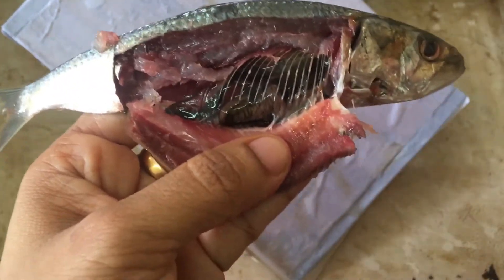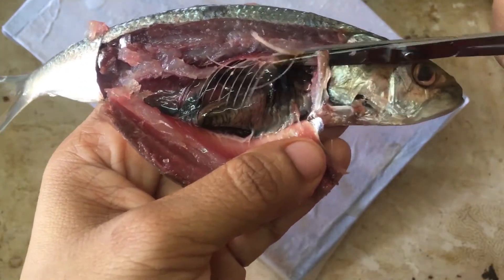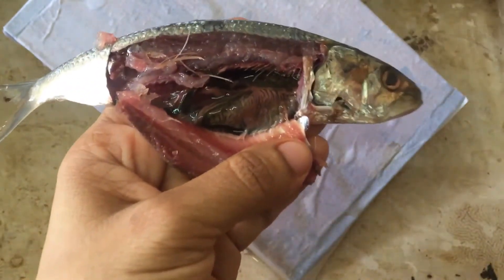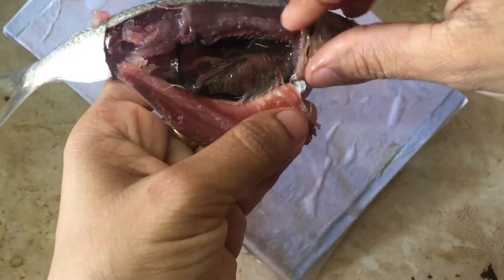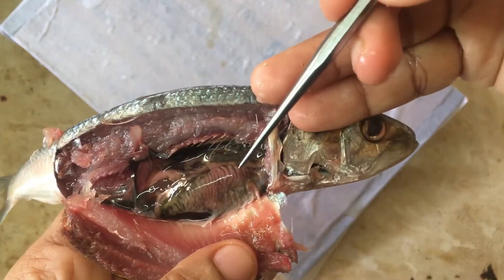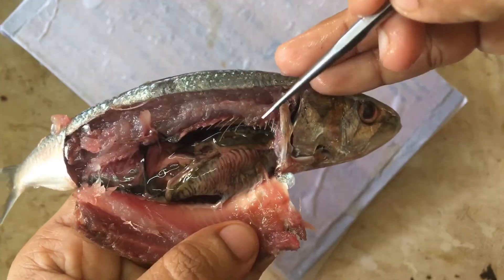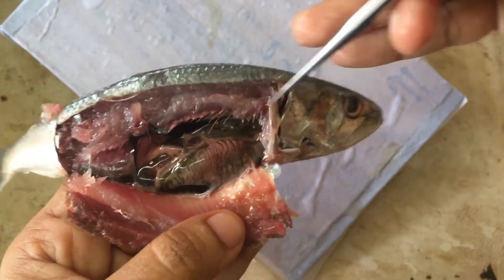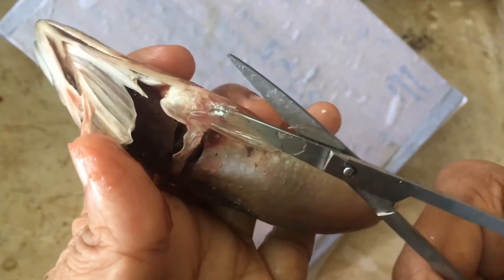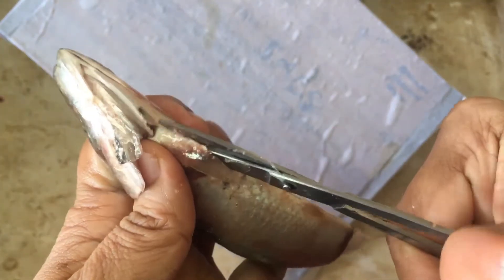We can open it inside — the tiny bones we need to cut out. We also need to open up the operculum to expose the gills. Here we can see the intestine coiled inside the fish, wrapped in a delicate membrane. I'm going to open the operculum and cut along its ventral side to expose the gills.